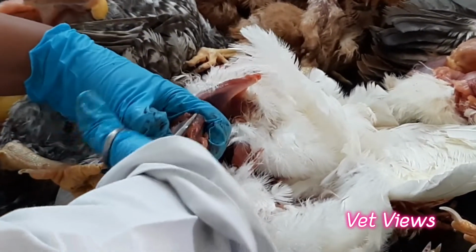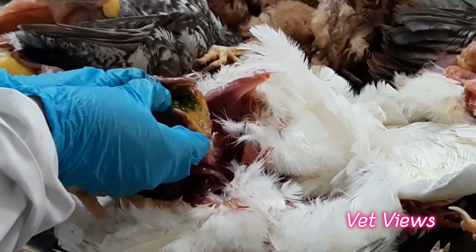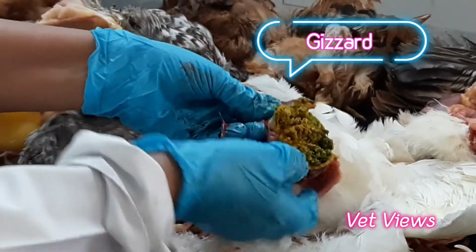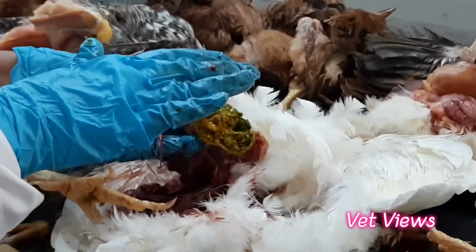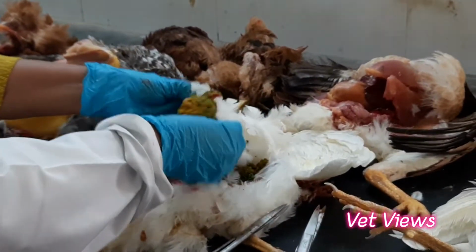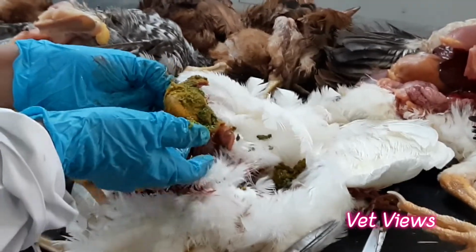In the gizzard, a few things you have to see, whether the bird has taken the feed or not. You can make that out by the presence of feed in the gizzard. This is the normal. So this bird has taken the feed, so there is no chronic condition. Also you can observe, sometimes if there are any toxins in the feed, this membrane will be hyperemic, and then necrosis also sometimes will happen.